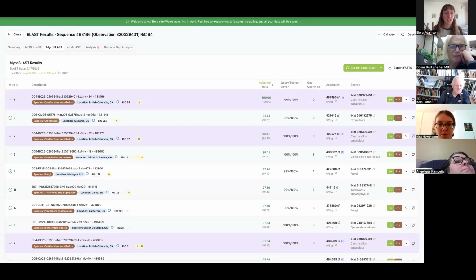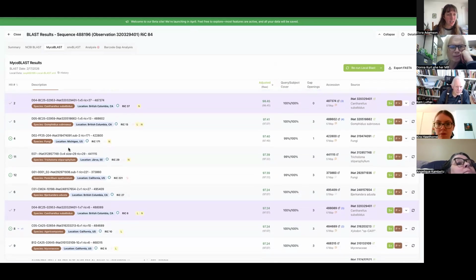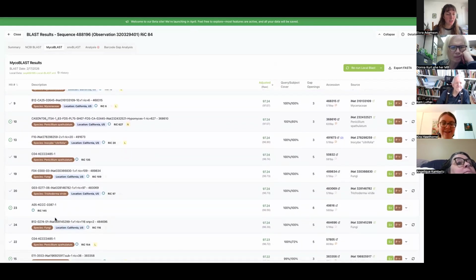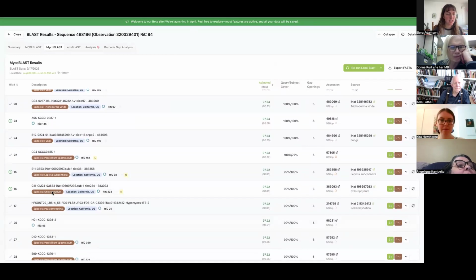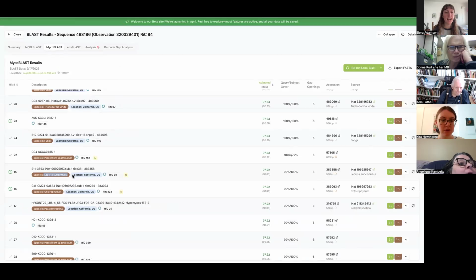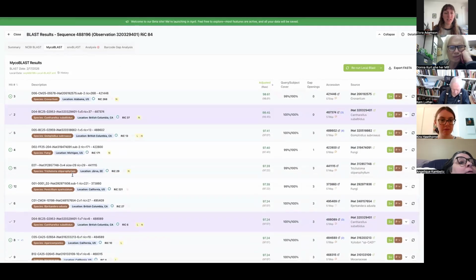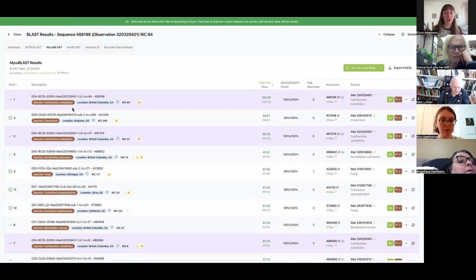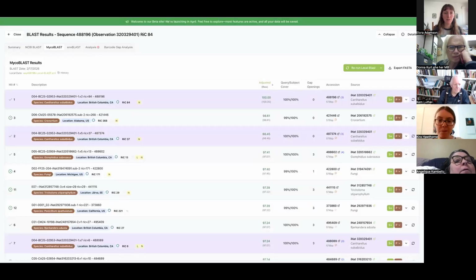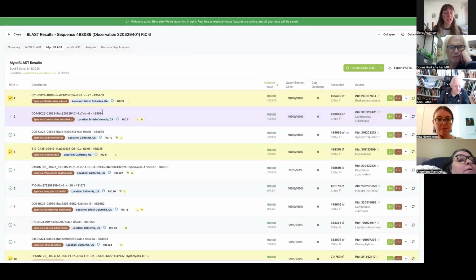This one, 84 reads, doesn't look good either. Trichoderma, Lepista, Chlorophyllum. These are all validated, so these are all things that have already been ID'd as this, but they had another associated sequence that all these things had, including ours. This 84-read one is definitely a contaminant. It's already been marked as non-target. That's what we want. I'm going to close this.